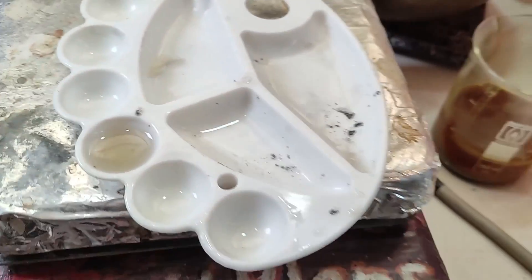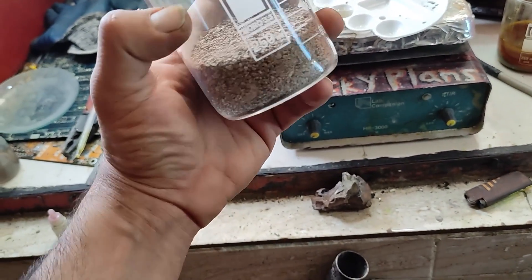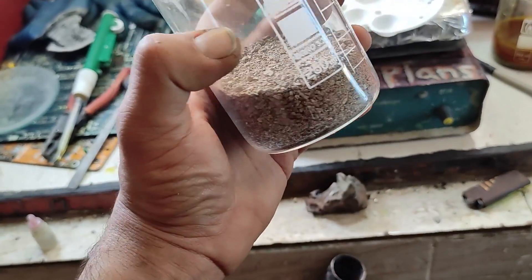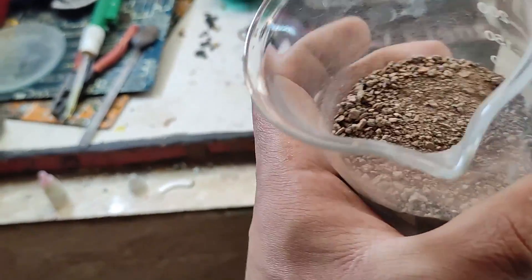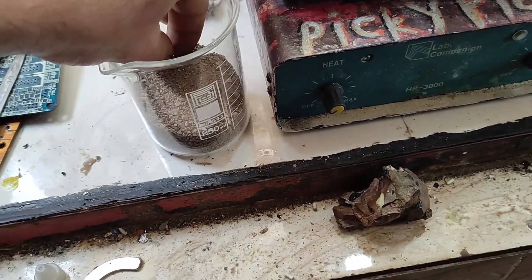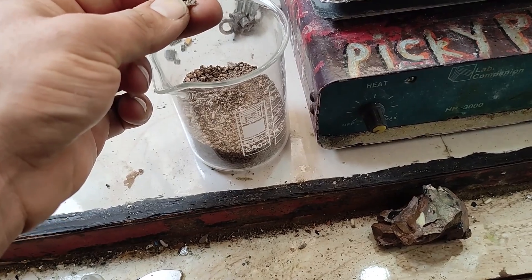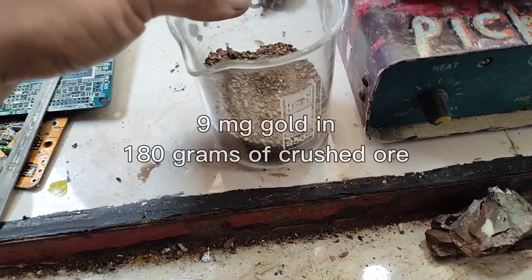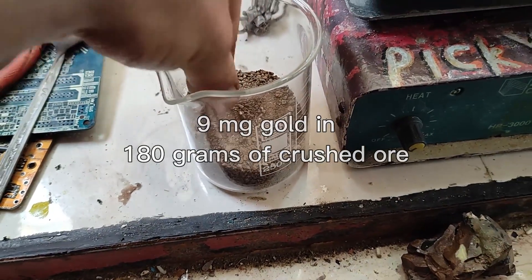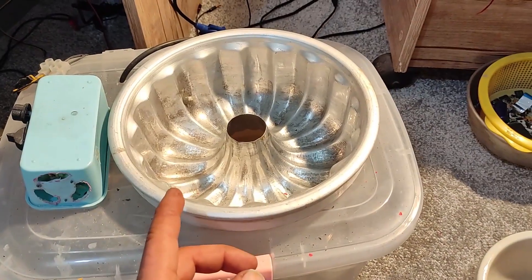That's why I came up with the idea of concentrating gold. I decided to concentrate 180 grams of gold ore sample and then attempt again to dissolve the gold and test it with stannous chloride. Assuming 50 ppm gold concentration, we would get a maximum of about 9 milligrams of gold from this 180 grams of ore, which is definitely a very low trace amount.